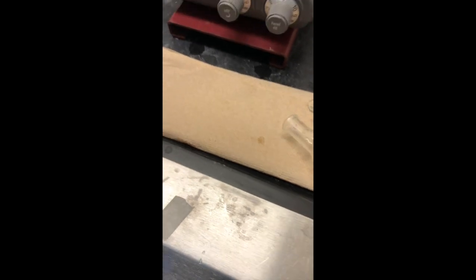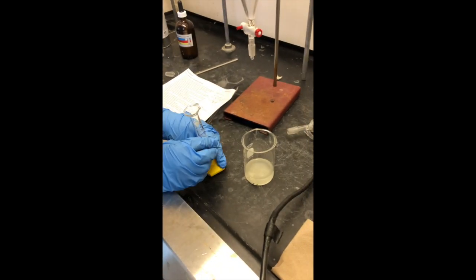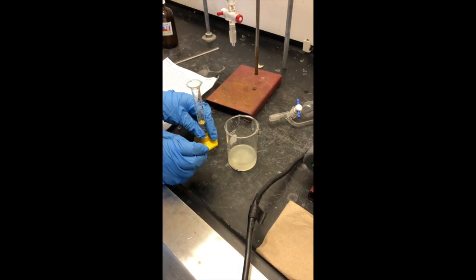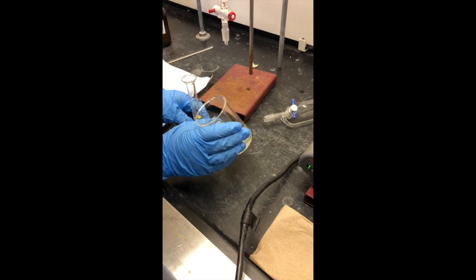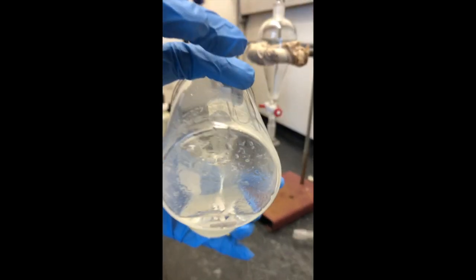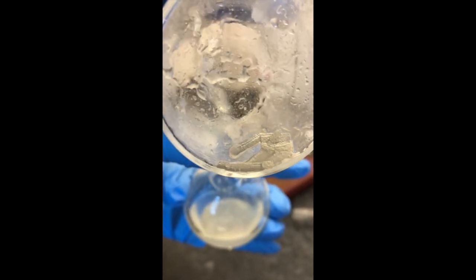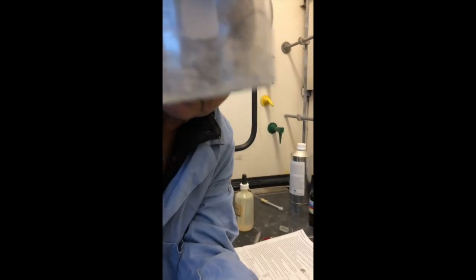Before we add the HCl, we can pull the magnesium strips out. We're going to get rid of the magnesium strips by removing them as best we can with forceps or a stirring rod or filtration. We're in the process of removing the excess magnesium by decanting — we've already decanted once. We're rinsing off that beaker with a little more ether to make sure we've rinsed all our product out, and we're able to leave the magnesium strips on one side.